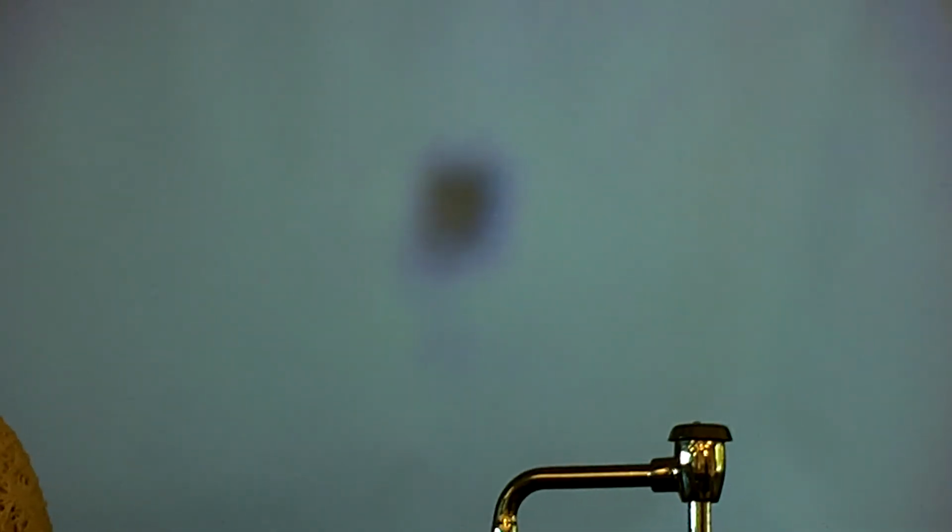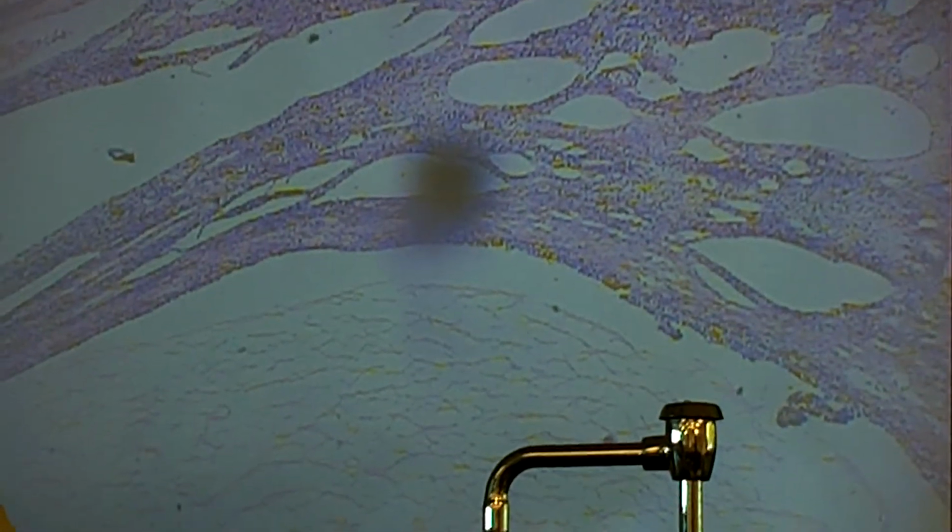And if you grab a corpus albicans slide, you're going to look around for a little kind of cloudy looking thing. Now here's another tertiary follicle that is filled with follicular fluid that doesn't have an oocyte in view. Massive. But this is not the puffy cloud we're looking for. You'll know when you see it. Let's see if we can find it. Oh, there we go. Sorry about the black spot. This is corpus albicans. You can kind of see the outer shape of it.